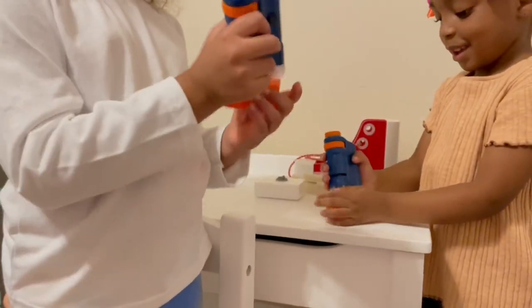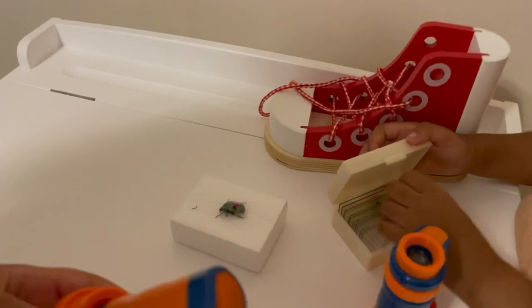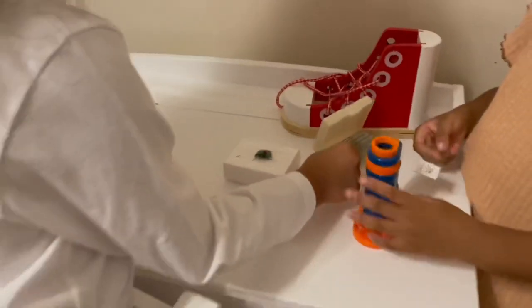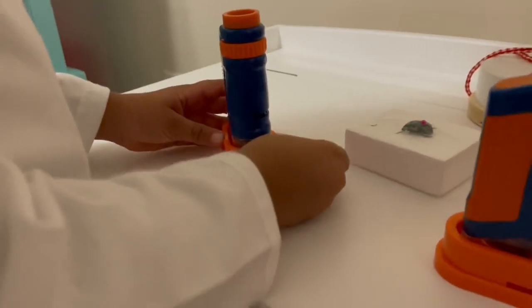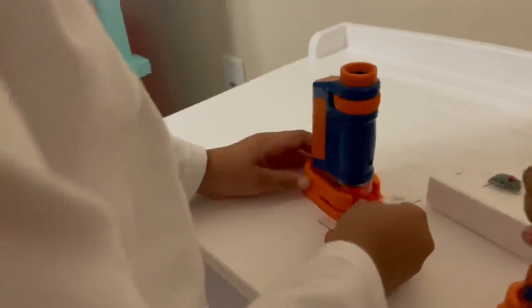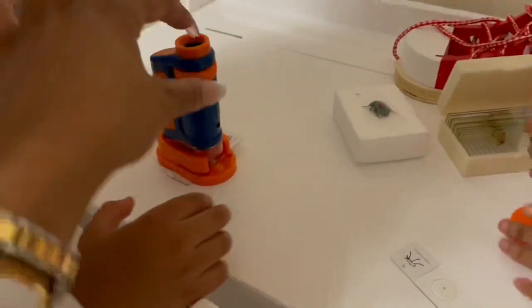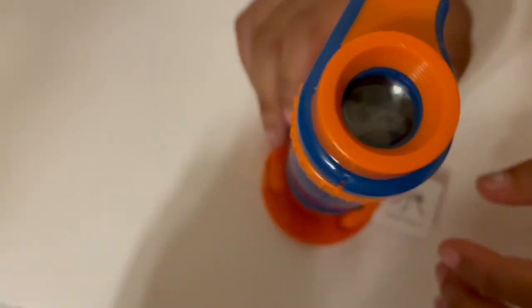Why don't you show us how to stand them on there, guys? Mine is on. Take one of those slides out. Be careful with it because it's glass and it will break. I can probably slide this under here. So it looks like we're going to be looking at mosquito antenna — that's what London's going to be looking at. Slide it under like this. Oh, look down here and press that flashlight on the side. You see something? Yeah. It says it's a honeybee wing.